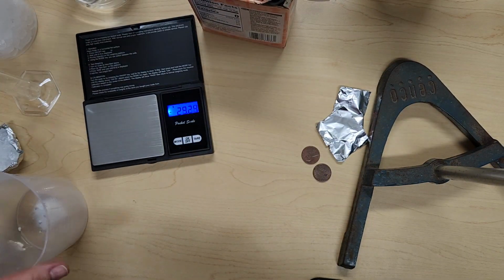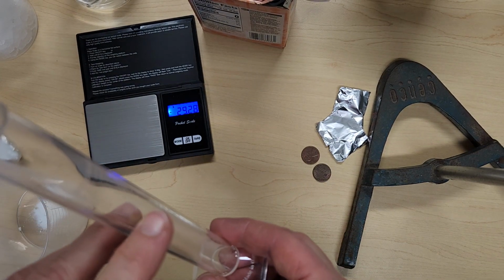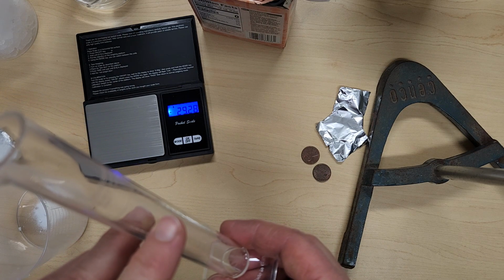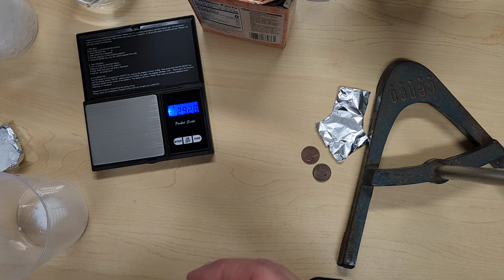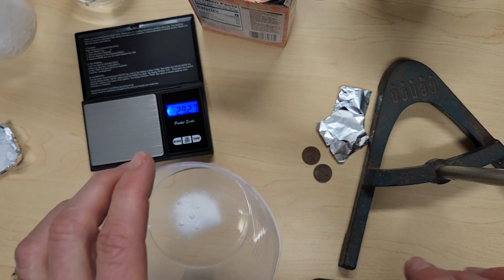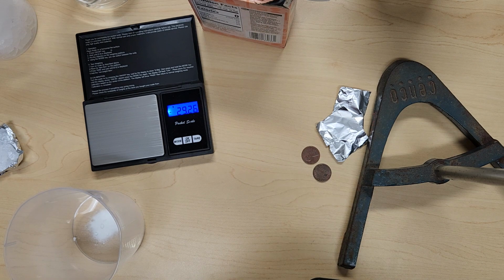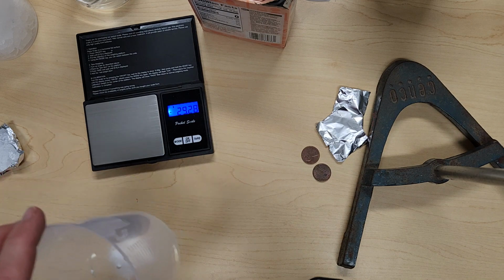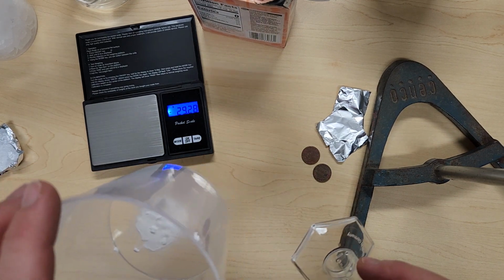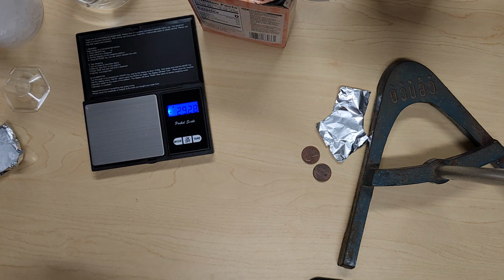Okay. We're going to use our clean, dry, graduated cylinder and add water. Okay. And then we're going to mix our baking soda and our water and record any observations. And again, you're going to try to decide what the temperature is, make some temperature observations, okay? Make observations about what's happening with the baking soda and the water. And take a picture, record your observations, and decide if it's a physical or chemical change.